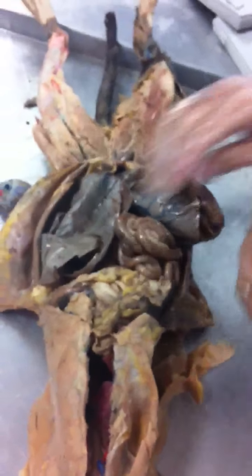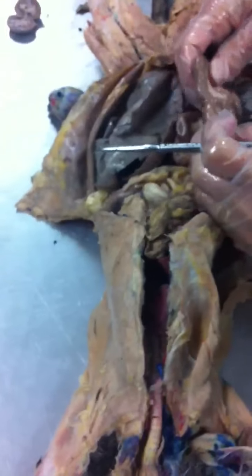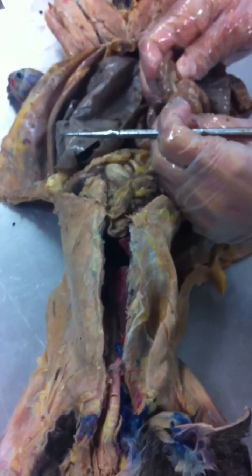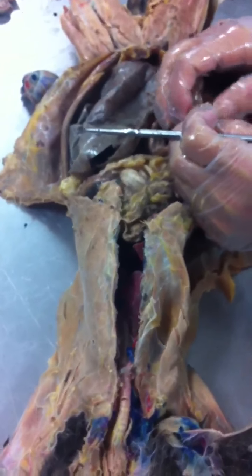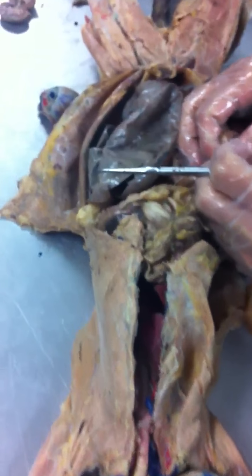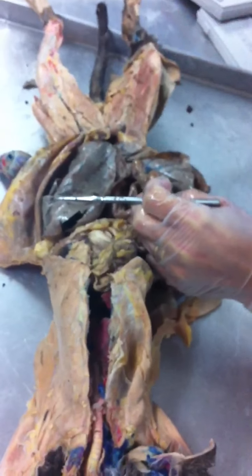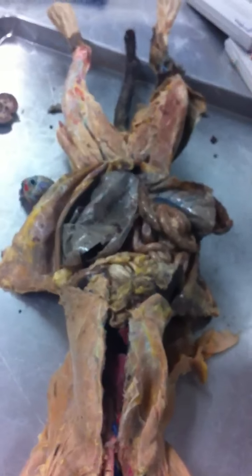Wait, so are you going to pin the anus and then pin the other hole? Are we going to have to search for these holes? Maybe. You don't have to do a lot of searching. It would be quite obvious if there's a pin sticking in its anus or in its urogenital opening. The one right under the tail is the anus. The next one is the urogenital. Okay.